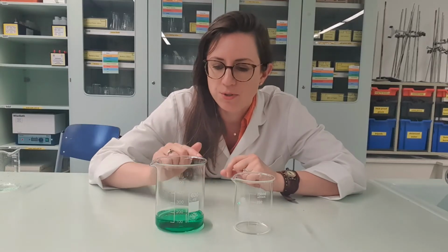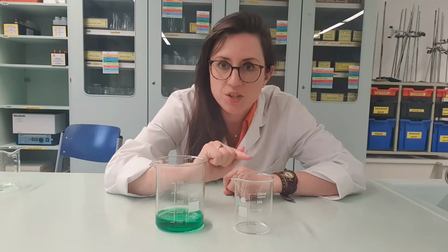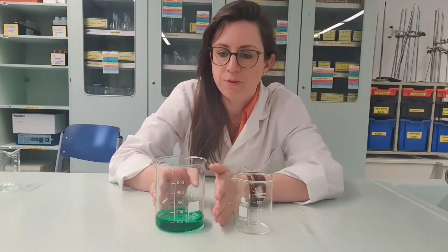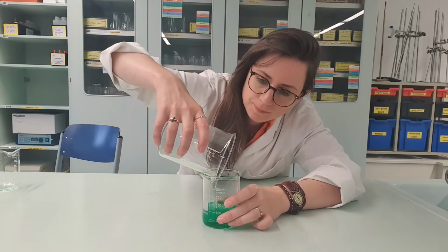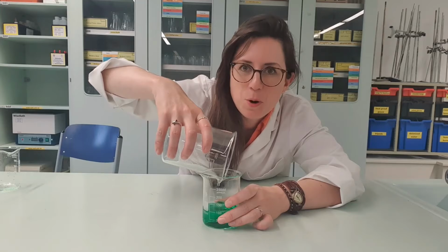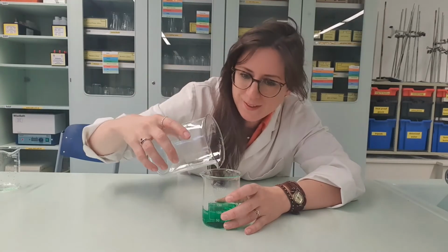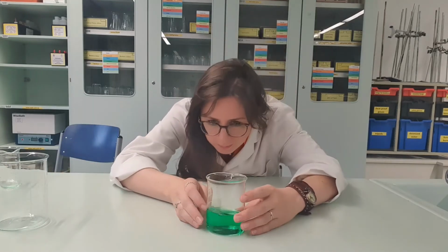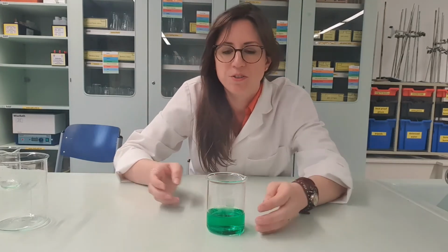Okay, so now what I'm going to do is transfer this 100 milliliters of liquid into a smaller beaker, which is a 250 milliliter beaker. Of course, I won't be able to get every drop in, but I'll do my best. There we go. So the new volume is just over 100 milliliters.